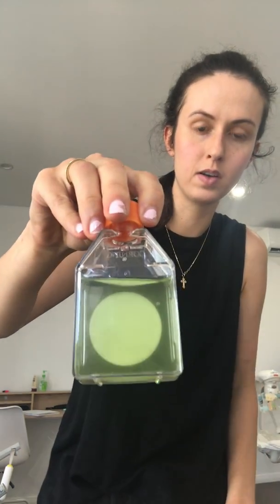Okay, so now we have two fresh algae cultures. These are less green than they were before, but now we have double the amount and they're just going to go darker and darker as the days go on. We're going to leave them near filtered sunlight — not directly on a window but near one so the sun still gets to them. We'll check and shake them every day, and hopefully they'll go as green as before. Then we'll move on to the next step, which is adding it to a larger bottle.